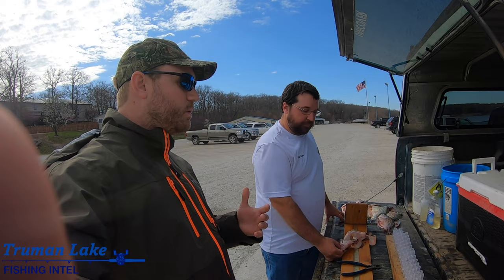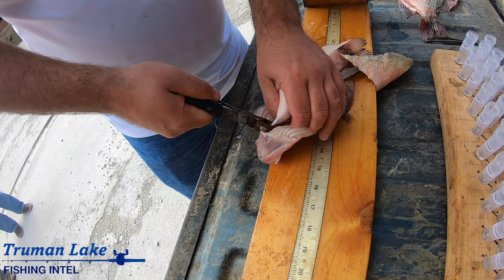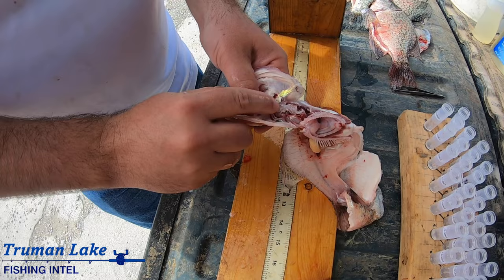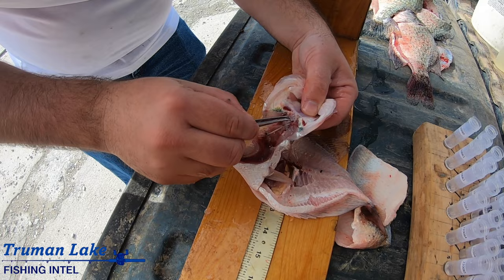So how would you describe an otolith? Well, they're kind of like their ear bone. I start by disconnecting the gills and then right where the gills meet the back of the head and the back of the mouth, pull that apart and there's a capsule right there. Take some wire cutters - that one did really well - you can see them both sticking out there. That's the otoliths right there.